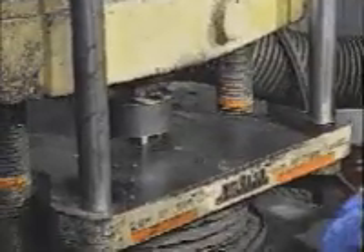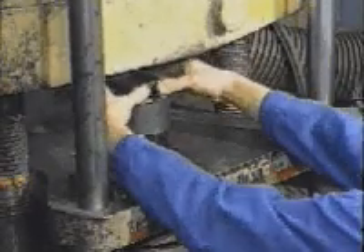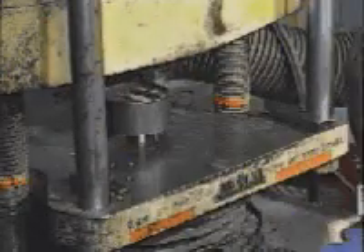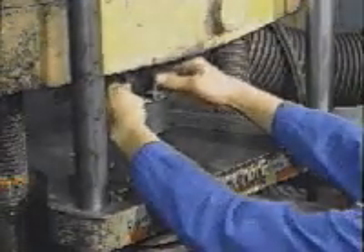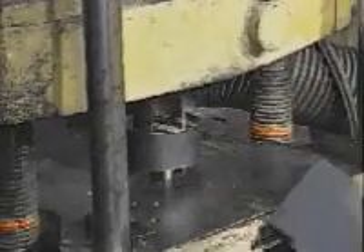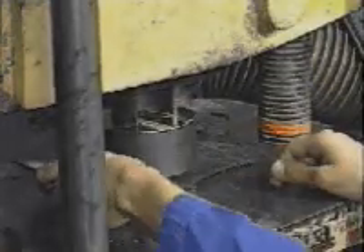Dwelling at pressure for as little as 10 seconds can increase iron powder compacted density by 0.3%. The green compact is ejected from the die by removing the upper punch, placing a spacer between the upper surface of the die and the upper press platen, and applying pressure. It is advisable to place rubber pads above the lower punch base or the lower platen to prevent tool damage when the die drops as the compact clears the upper die surface.